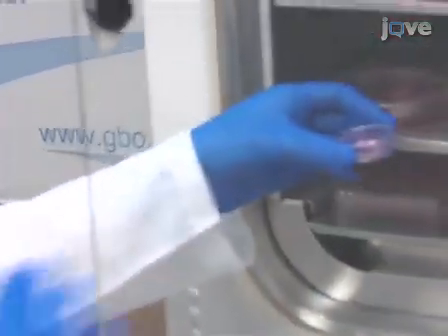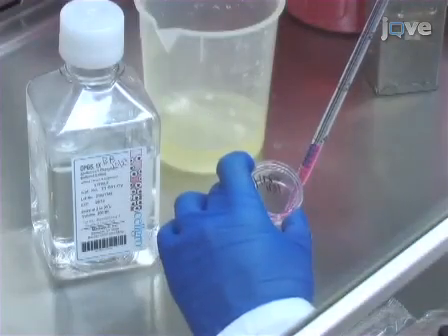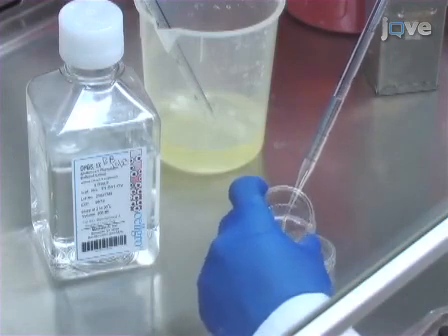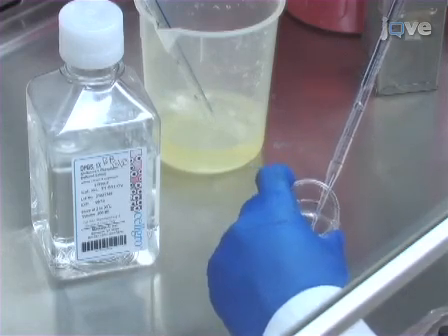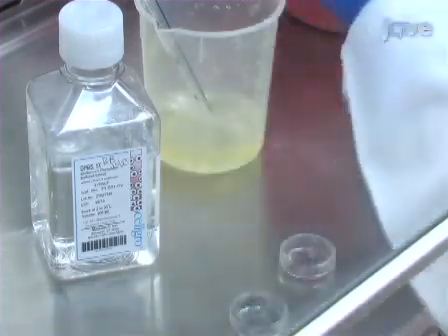Incubate overnight at 37 degrees Celsius and 5% carbon dioxide. After removing the viral mix, wash the surface of the cells twice with PBS to aid in removing viral complexes. Complete removal is not necessary, as no adverse effects on cell health have been observed from residual polymer complexes.